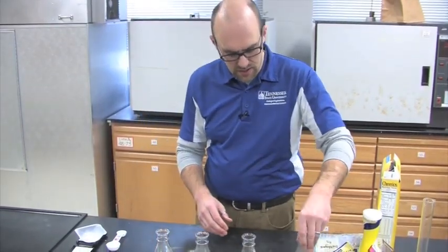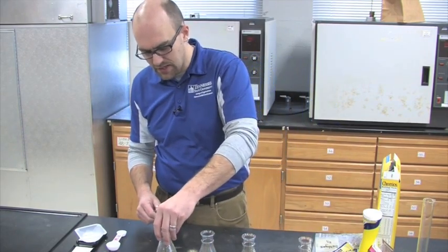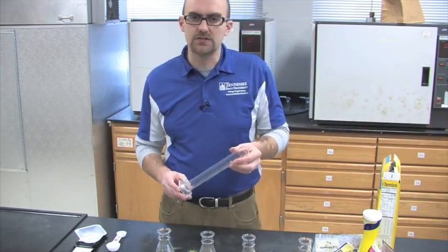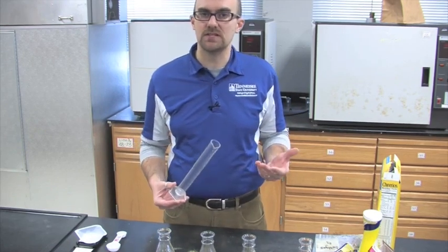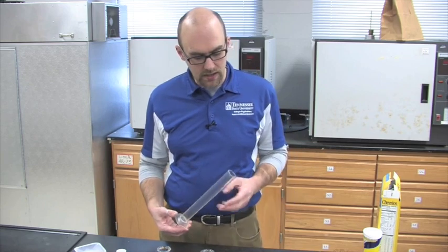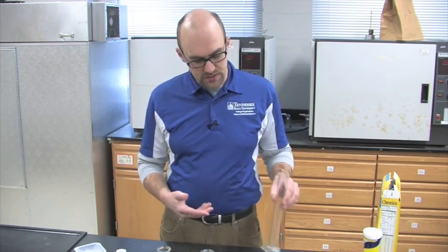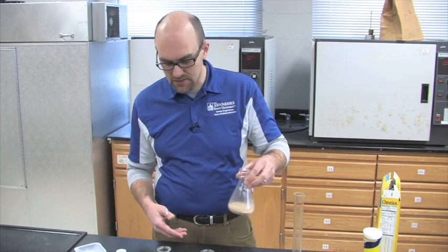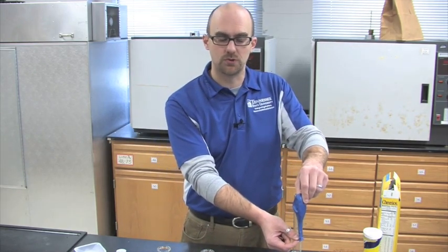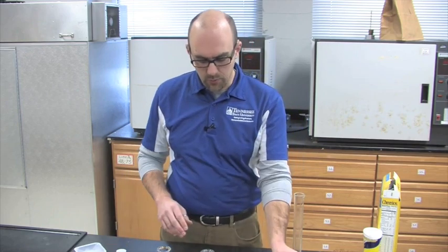Now we have the yeast and our different materials mixed together in each flask. The next thing we're going to do is add about 100 milliliters of warm water. This is going to activate the yeast — essentially wake them up — and then they'll be able to break down the sugar and produce the ethanol and carbon dioxide that we're hoping to measure using the balloons. Once I've added the water, I'll swirl the flask and put the balloon on top. The flask that ends up with the largest balloon produced the most ethanol because it had the most available sugars.